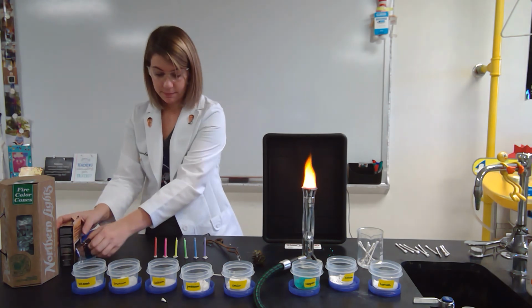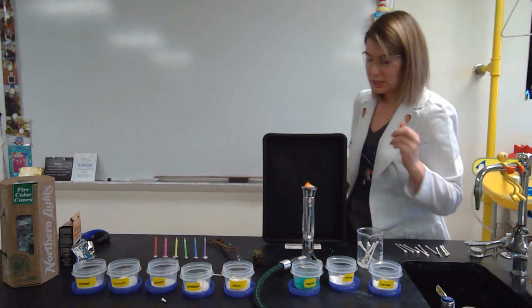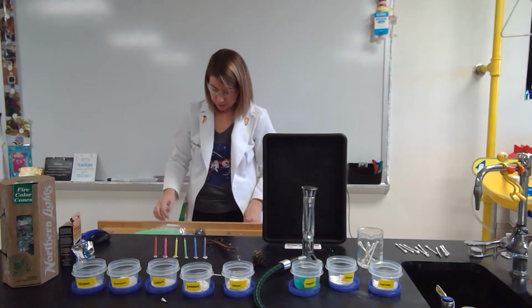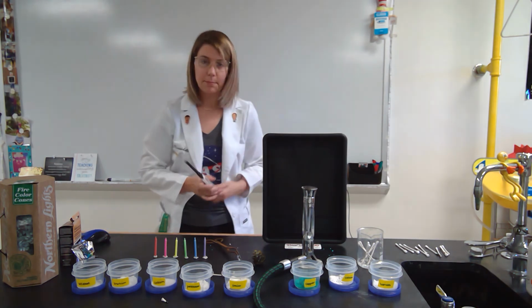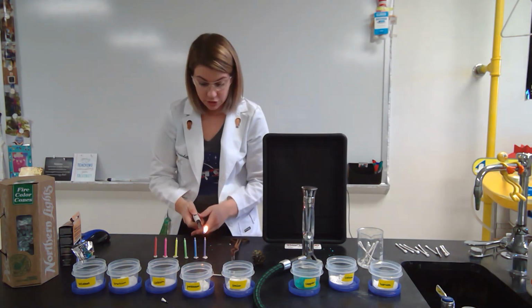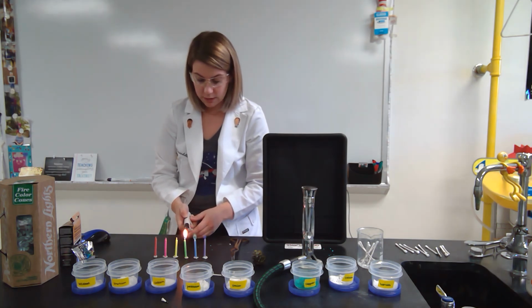Last but not least, maybe if you've had a birthday that you've ever celebrated and you guys celebrated it in style, you can get these birthday candles and they burn different colors. So there is something special inside of each of these birthday candles to make them burn those different colors and make their flames different colors. So let's light these candles and talk about what substances are present here.